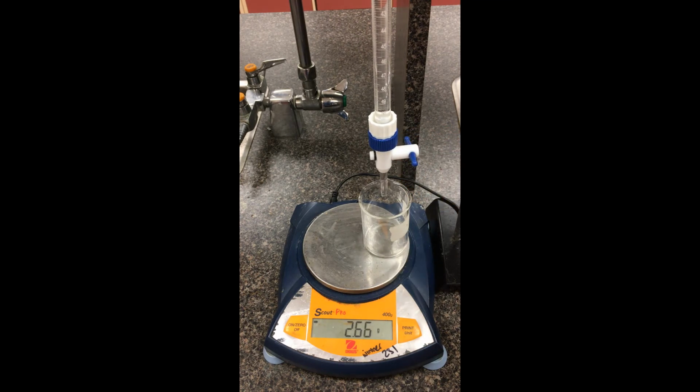So methanol went a little too far here, so that's 3.30. There's a mass of 2.66. We're going to go down to the 6. So 6.10 has that mass there. Going down to the 9, so 9.02 has that mass. Going down to the 12, so 12.21. Where's the mass? 15, I'd say 15.12. There's that mass there.